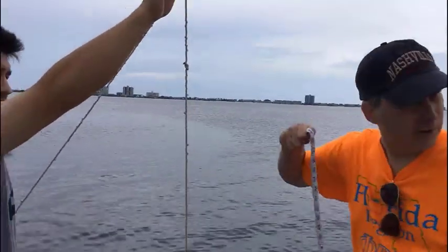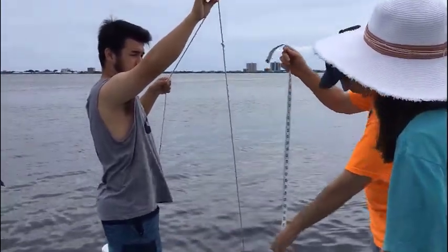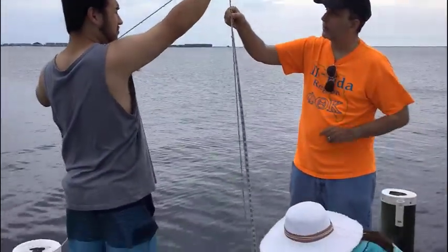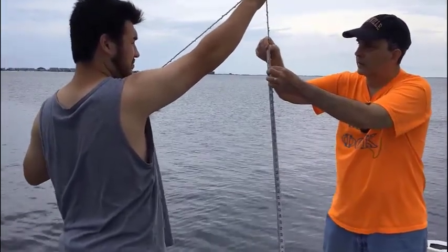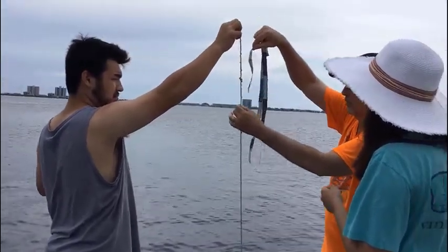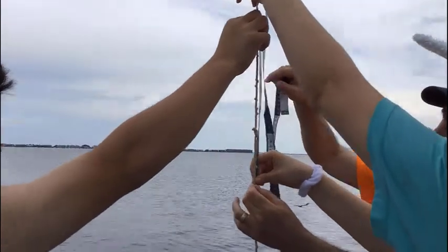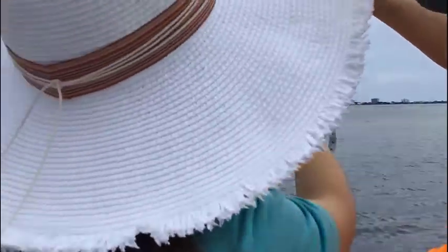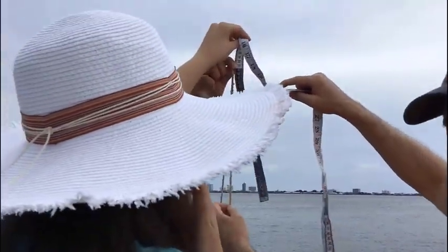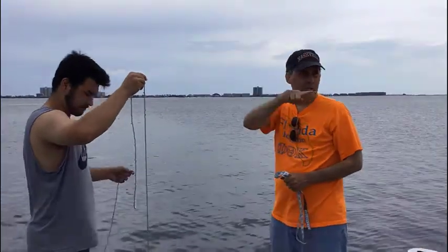We're just going to measure from the Secchi disk to the point where you pinched, and we'll say the visibility is greater than that depth. It's going to be more than a meter. It's at 1.5 meters here, plus 30 centimeters — that's 180 centimeters, or 1.8 meters, would be the depth of visibility. Put the greater-than symbol in front of that on your data sheet.